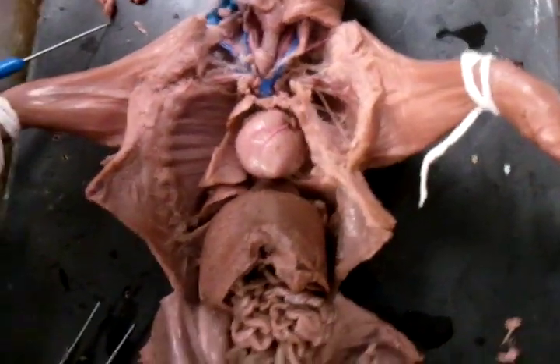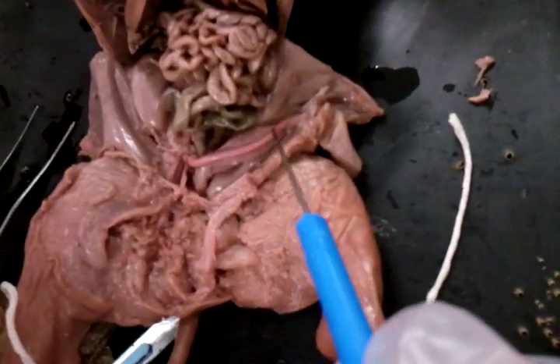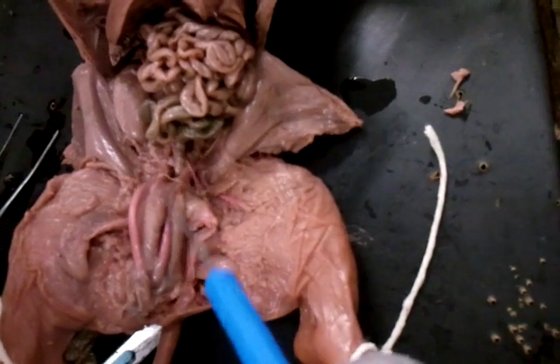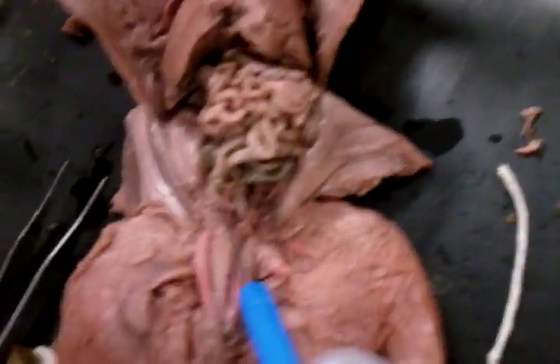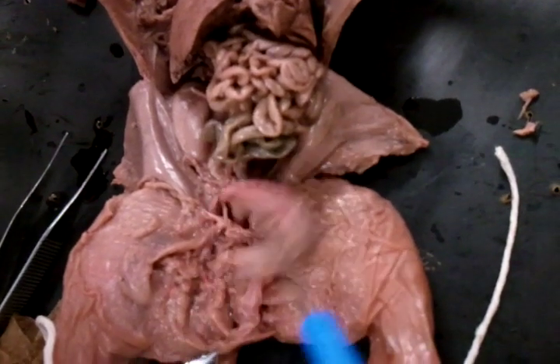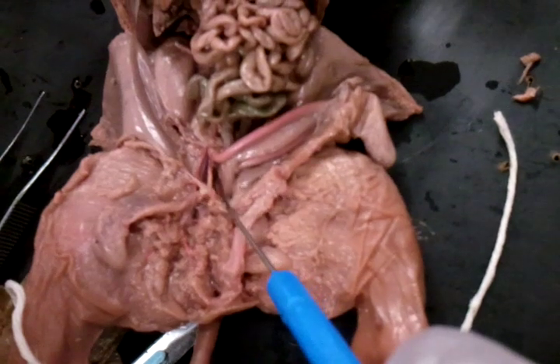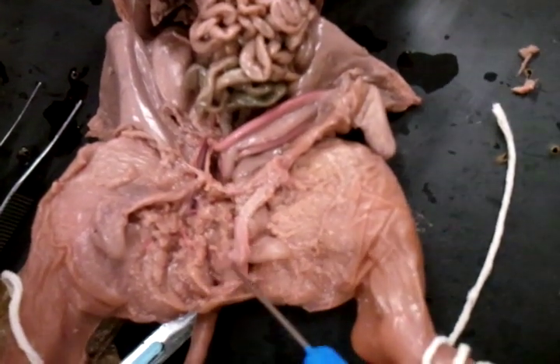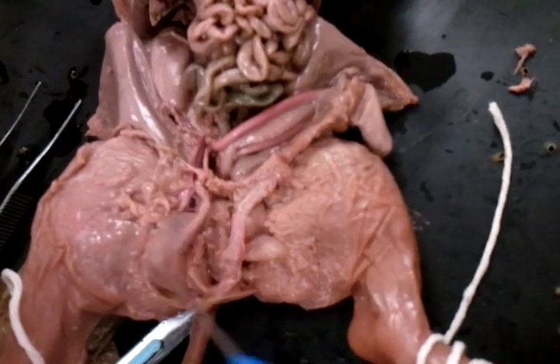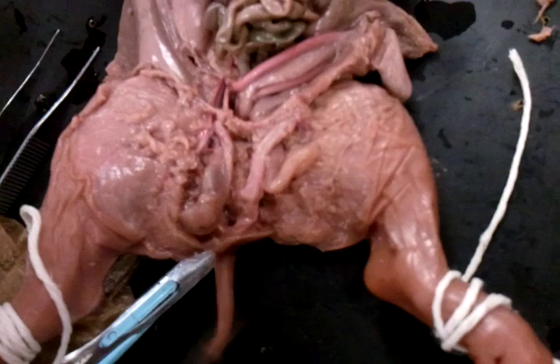Umbilical arteries — these two. Ureter from the kidneys, which are these. The urethra, which connects and goes under all this meat and connects to the penis. Testes — right here, there's two of them, and this area is the scrotum.